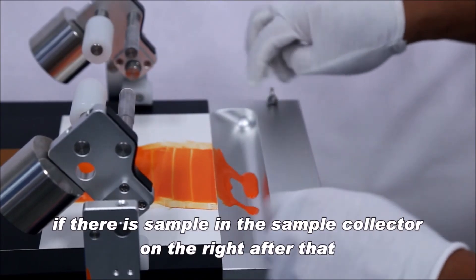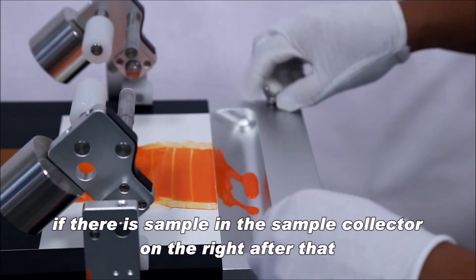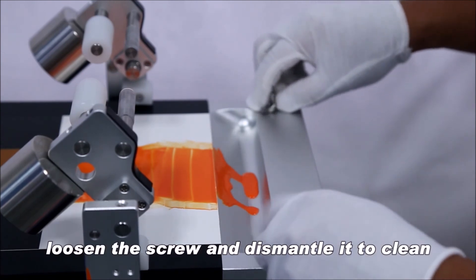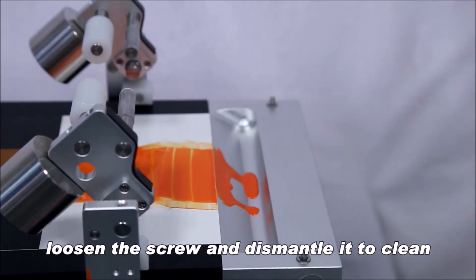If there is sample in the sample collector on the right after that, loosen the screw and dismantle it to clean.